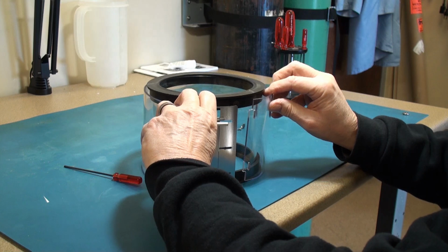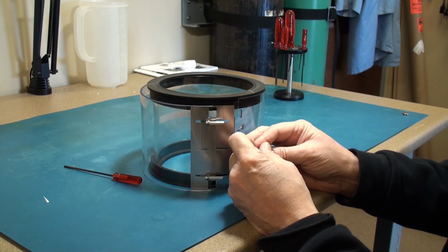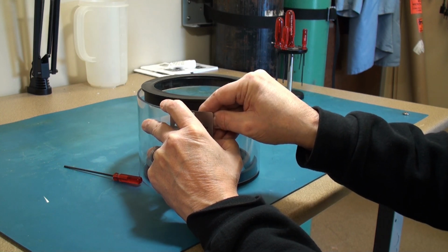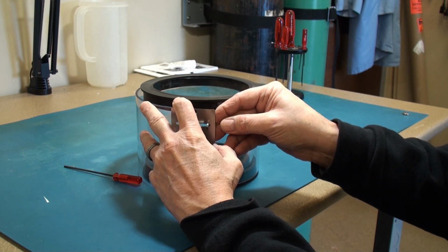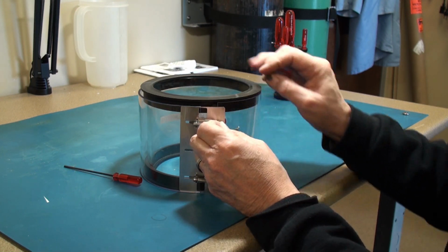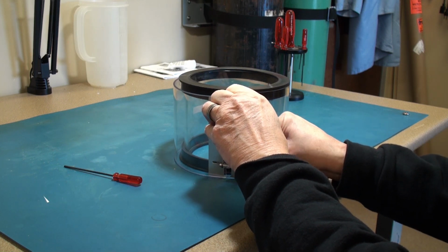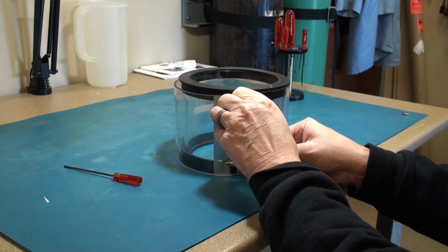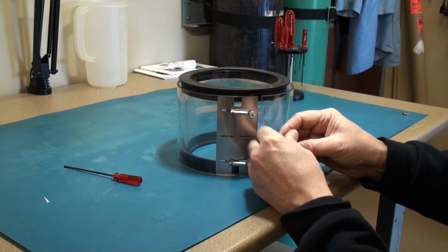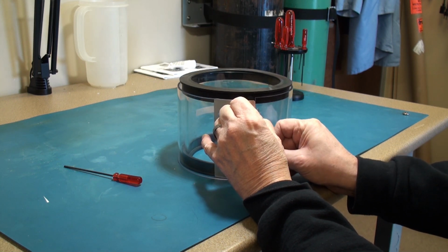Then the implosion guard gets put back over top, and this is where the tricky part ensues. You need to insert these little L tabs. You want the side of the L tab with the hole coming out, and you need to insert them horizontally, then turn them vertically. Then the other side. Yes, this is the challenging part, keeping this all together while you put it together.